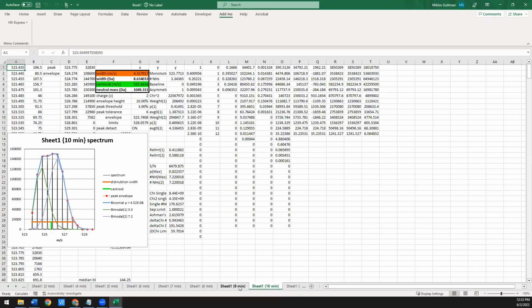So the next thing that you can try to do is to actually extract information for what the relative deuteration and relative intensities of each of these 2 populations are. That's already kind of given here. So in cells I16 and I17, this is the relative intensity of population 1, the one in green. That would be 41.1% of the total intensity. And this would be the second population in blue. That's 58.8% of the total intensity. And then here, average D1 and average D2, these are the deuteration levels of the green and the blue, respectively.